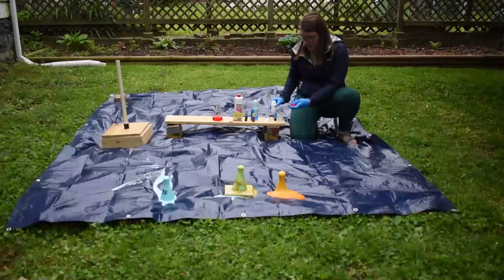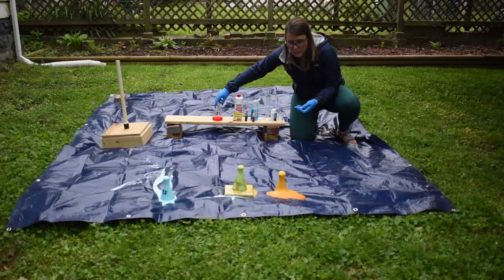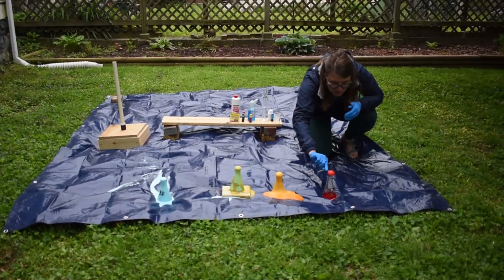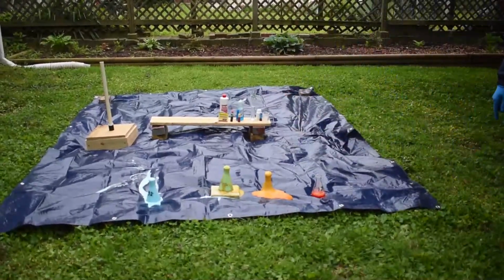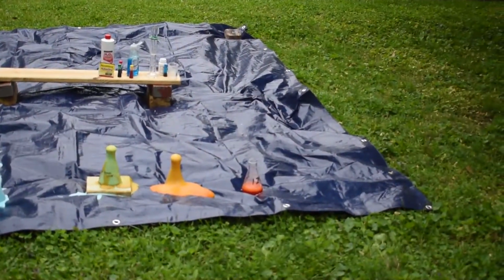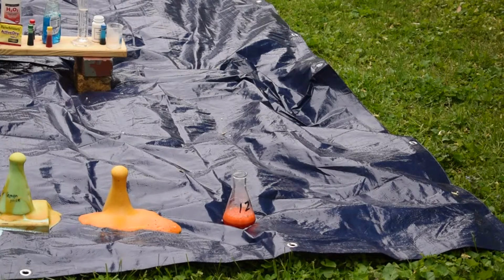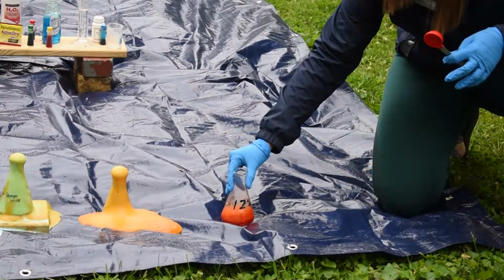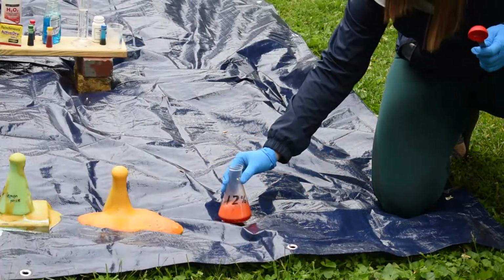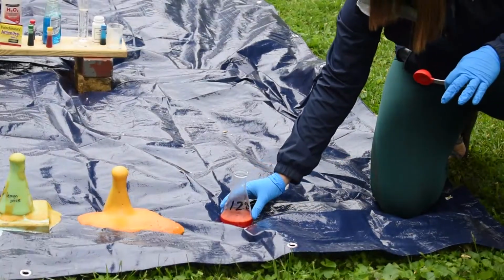I have my full tablespoon of potassium iodide. I'm going to put this here, and we're going to let it happen. So this one's definitely reacting a little bit quicker. There we go. It's doing its bubbling. It's getting fizzy. It's also getting very warm to the touch. This is a very exothermic reaction.